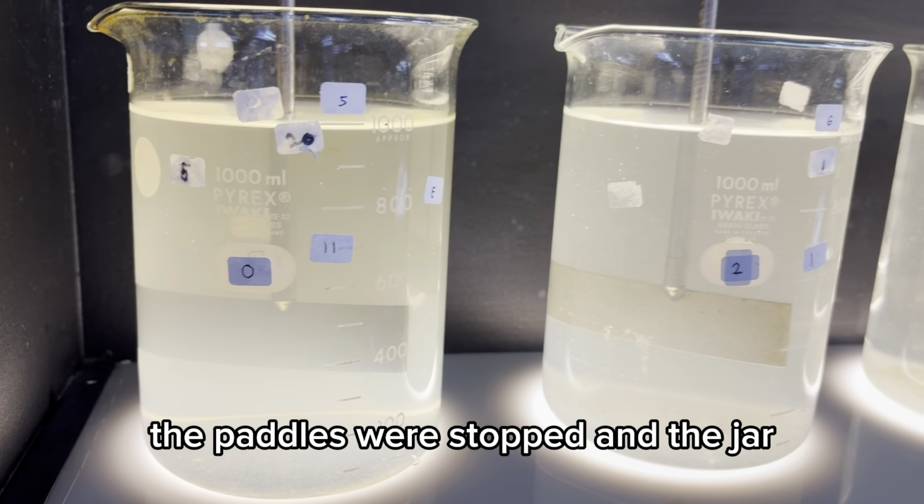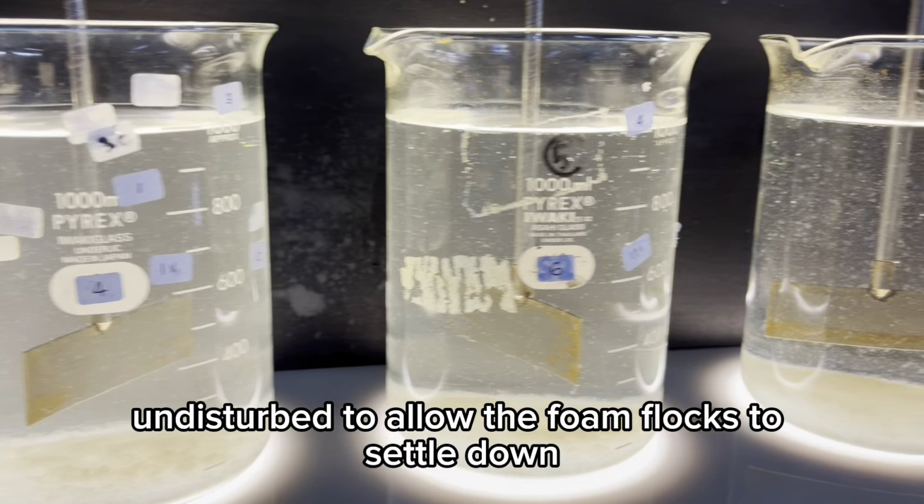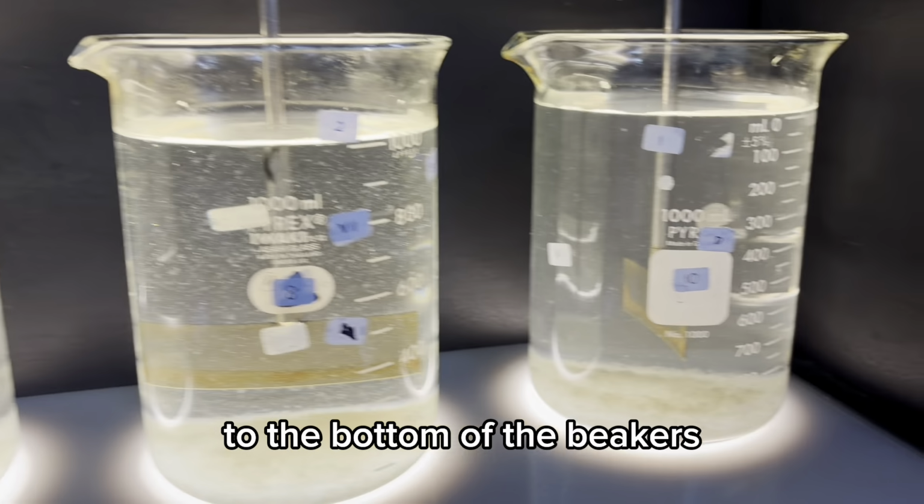The paddles were stopped and the jars were left undisturbed to allow the formed flocs to settle down to the bottom of the beakers.